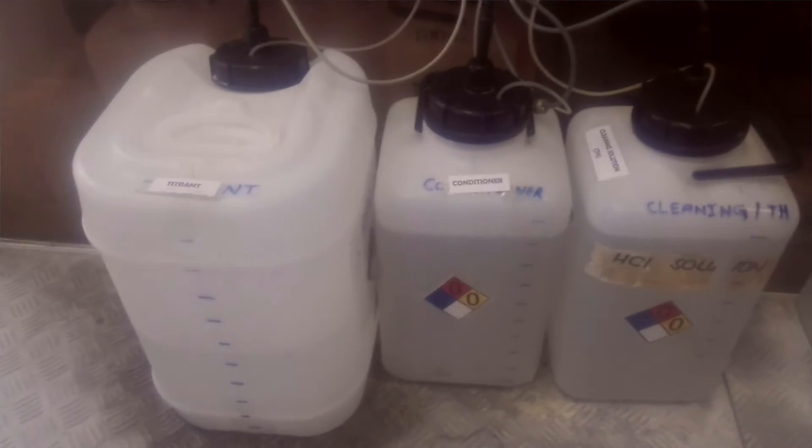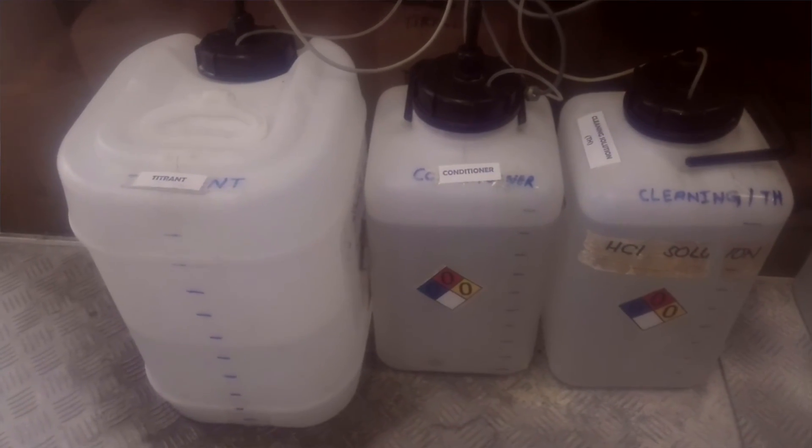These are the reagents and cleaning solution, which we will discuss later. Okay guys, I hope you understand something about the basic components of this analyzer. It is the beginning. Be patient and remain with me. We will meet you again on the next part of this analyzer: how to configure and how to set up the analyzer for starting operation. Thank you very much.